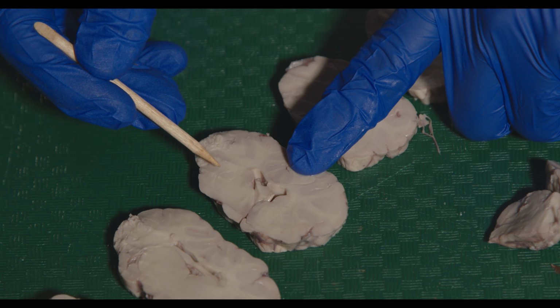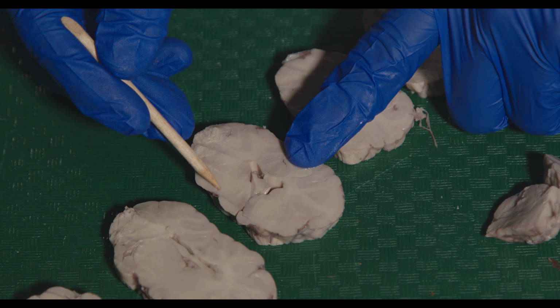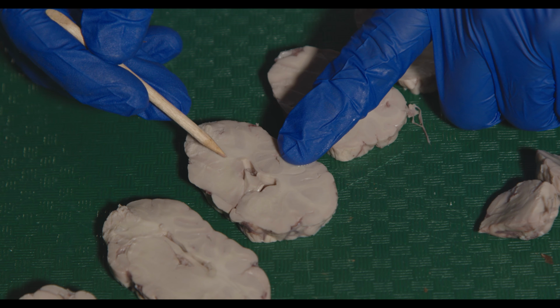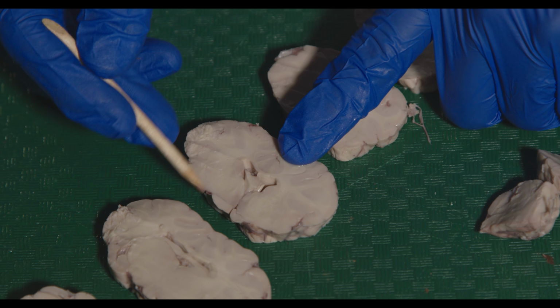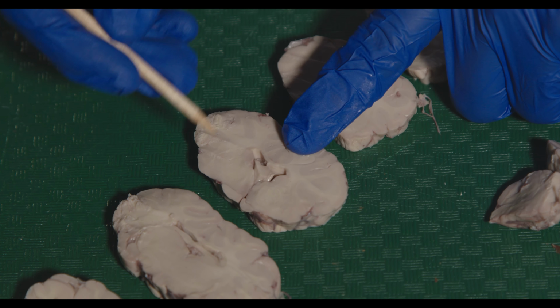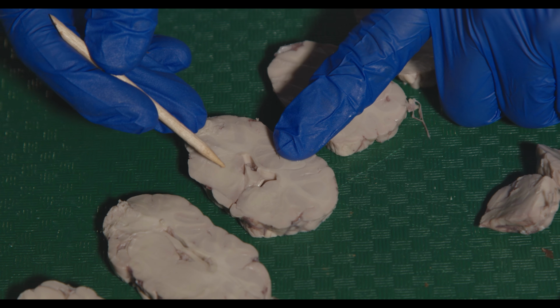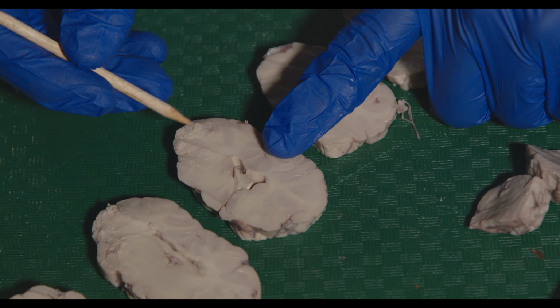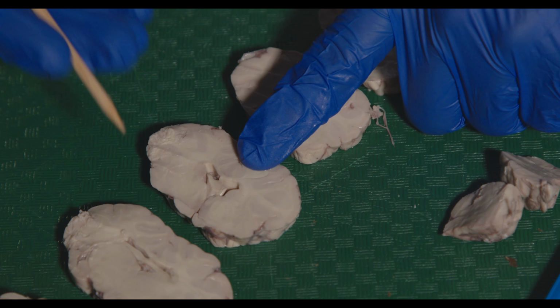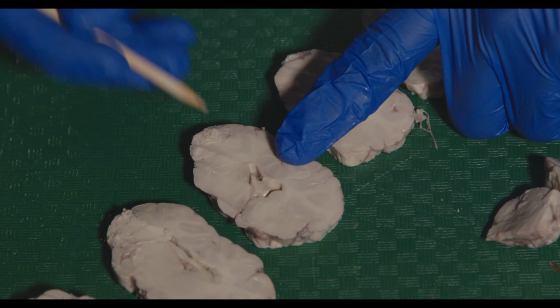Then if you were to go a little bit lateral to the caudate, you will see essentially the internal capsule. These are white matter fibers that are connecting the cortex to fibers that are going through the brainstem, or to the brainstem. And then you can see the putamen, and the globus pallidus is in here. Globus pallidus means pale globe, so it's hard to see on an unstained specimen, which is where it gets its name. It just looks like it's part of the internal capsule.